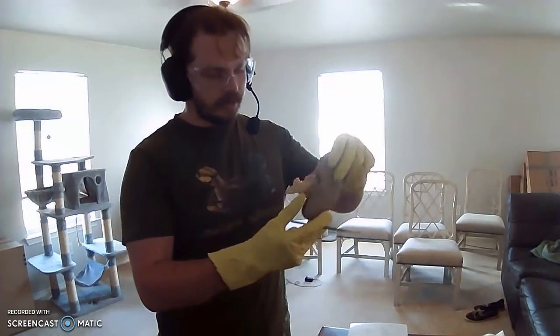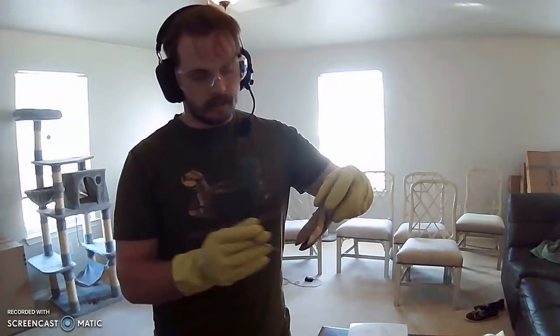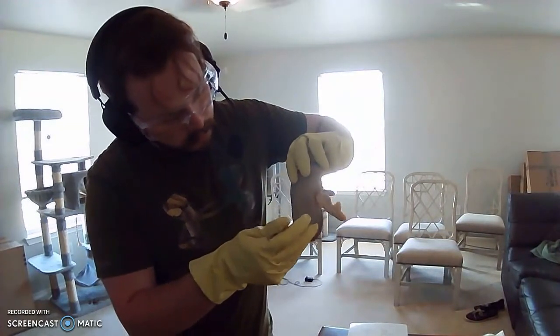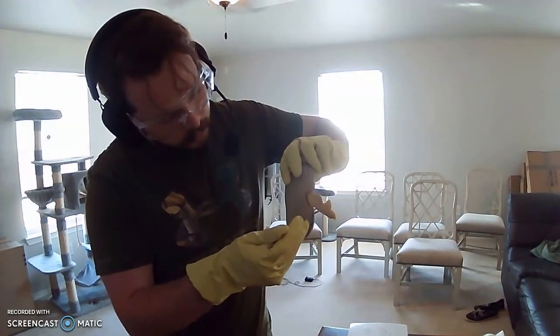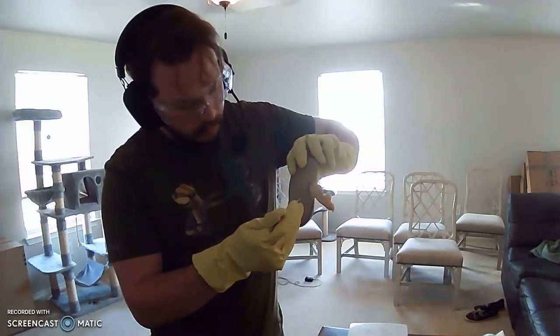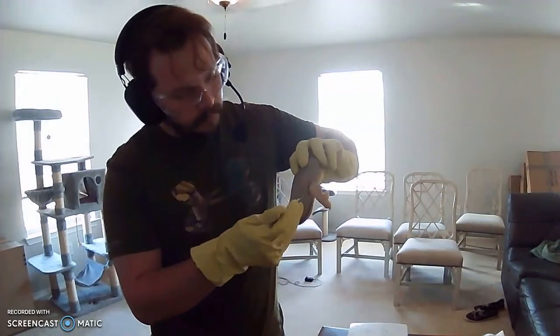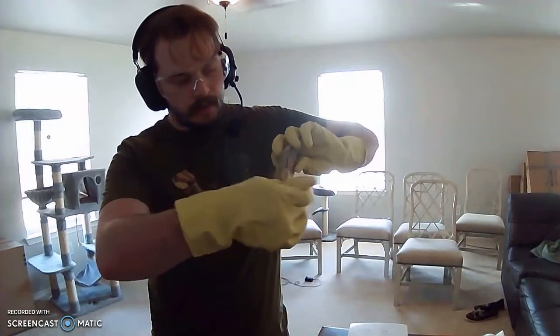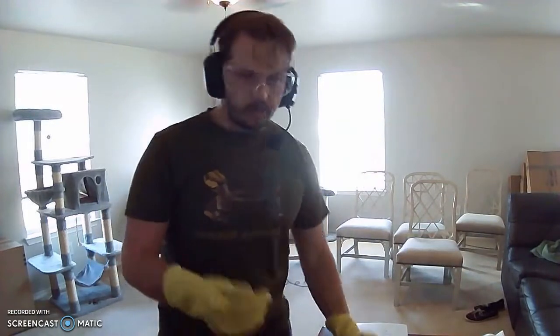Now, let's talk about some of these identifiable external structures. Right here, we have the superior portion of the ureter, which leads up to something called the renal pelvis. It runs internal to the kidney. Now, right in this area, it's going to be surrounding this whole area. If we went around like in a circle like this, we're going to have other vessels, such as blood vessels, lymphatic vessels, kind of run in, as well as this ureter, this drainage system. And that area is called the hilum.